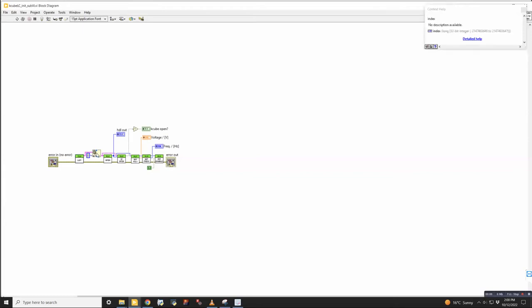So we take that and put it into this open sub VI. The open sub VI makes the serial connection and it outputs this handle out. So the handle out is a 0 the first time that it runs, and it's a -1 if there's an error. So if you see a -1, then you're going to have a problem. You're probably going to need to shut down all the software. I would connect to it in the way that I did before, where you connect to it with the KLC software with LabVIEW closed, and then you disconnect from it, and then you close the connection. Restart doing that with LabVIEW.